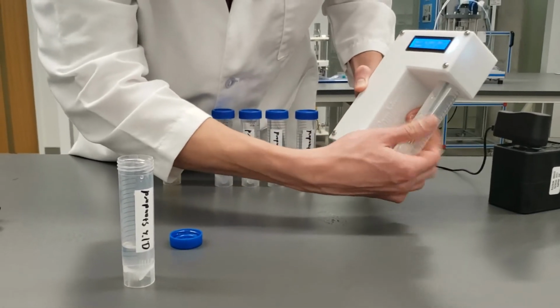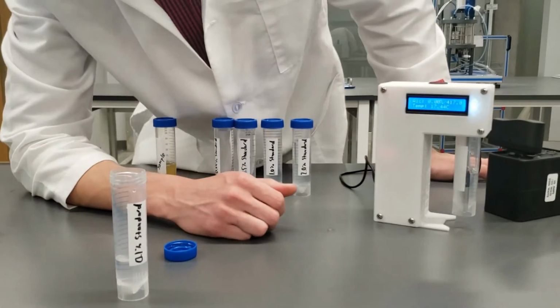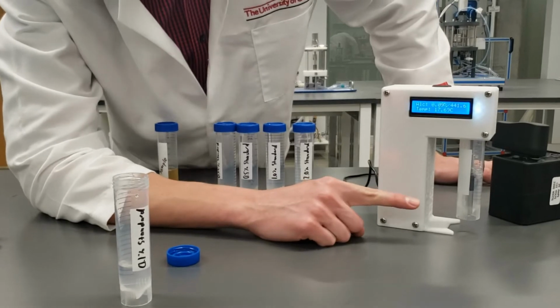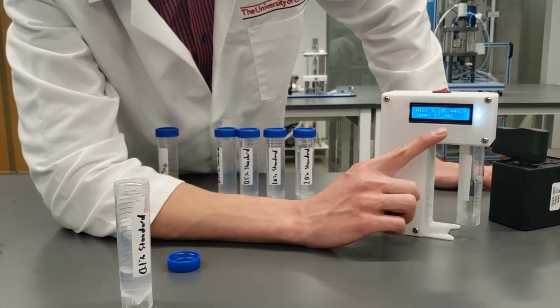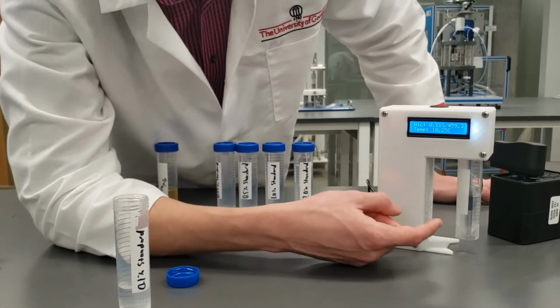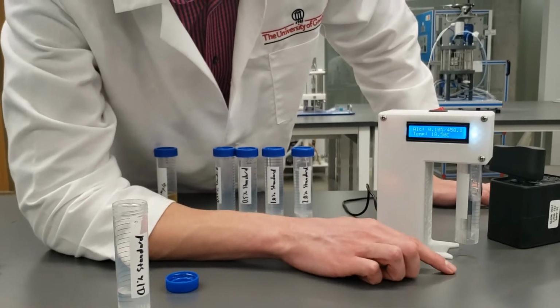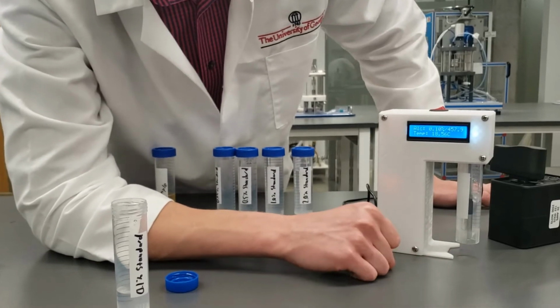And we're gonna screw it into the detector and see what number it gives us. Now, especially on the lower percentages, you might be a little worried that you get very different readings on the raw values. However, it's perfectly fine. Just keep going with the measurements, and once you're finished with all of the samples, you'll see that the curve on the graph matches the data nicely.